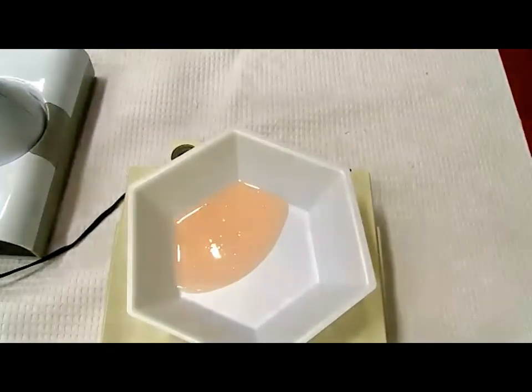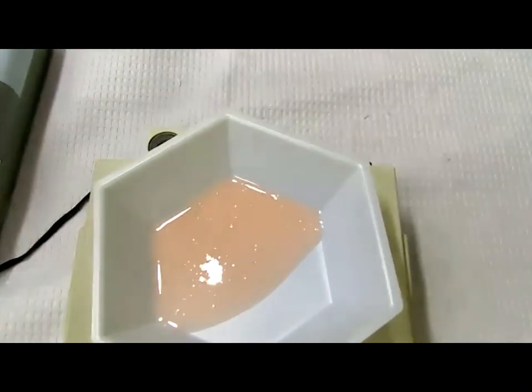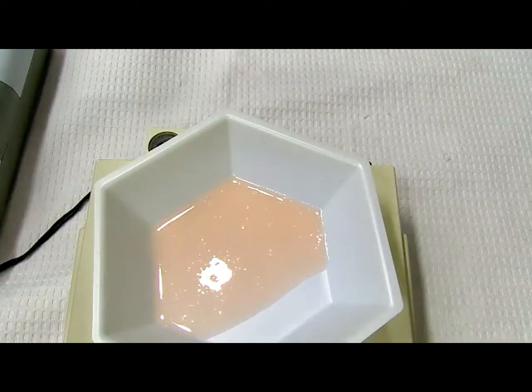You did a really good job. That is an excellent job. So, would you agree? And let's see, I don't know how well you can see. I'll zoom in a little bit. Let's describe this. Remember, in our crazy way, let's put a color to that. Thank you, Dr. Wu. What color is that? Let's call that pink. So it is a pink. This is under visual description.